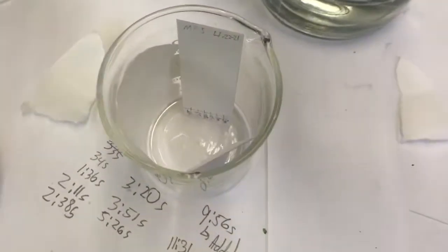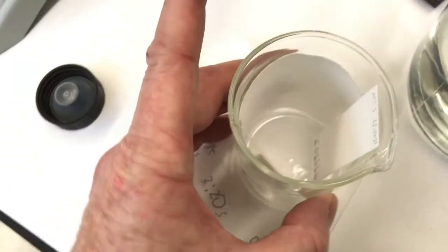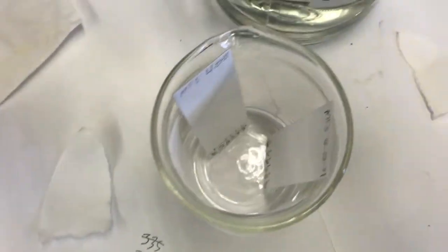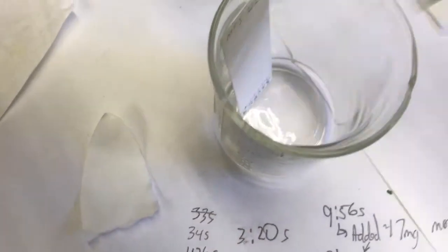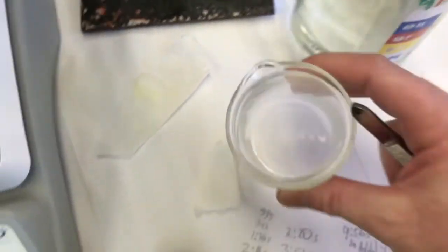That should work. I'm testing if I can run 2 TLC plates at once in the one methylene chloride chamber. It looks like I can. I don't have any methylene chloride in there yet, but I tore back my wick a little bit on the sides, and now I can have these 2 TLC plates in there not touching each other and not touching the wick. I can even move this over a little bit. Yeah, plenty of room for 2, so let's do this. I'll take those out, and then I'll fill up the chamber with methylene chloride. You can see I tore off the sides of the wick just to give me a little more room.